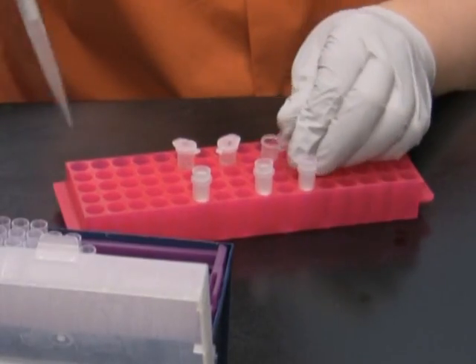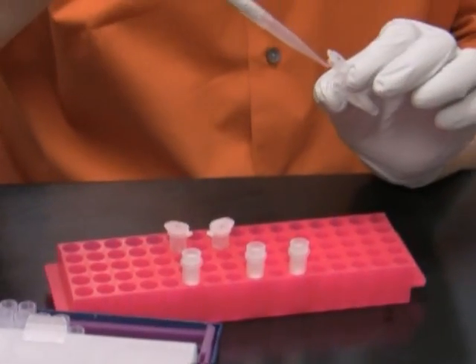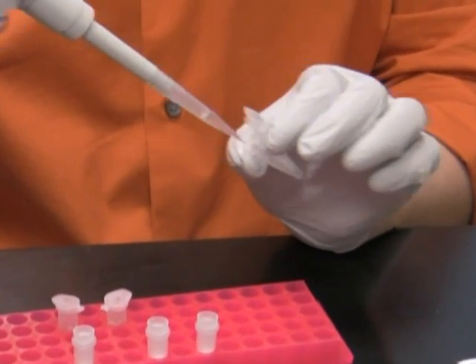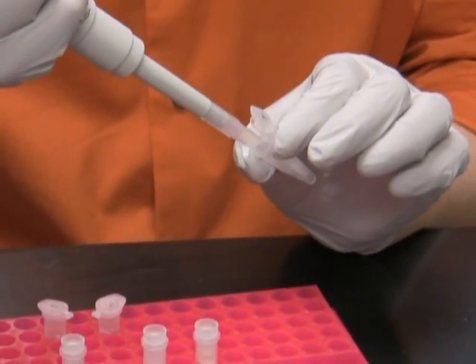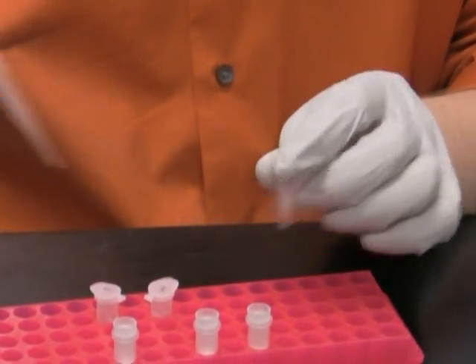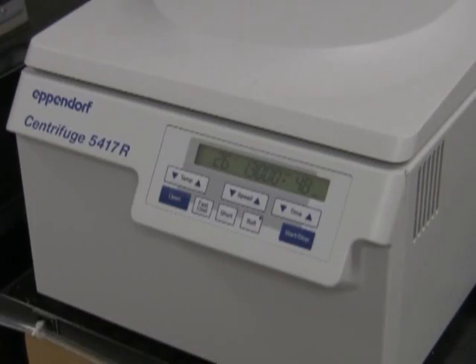Then I transfer the supernatants to spin columns and spin for one minute in a centrifuge.